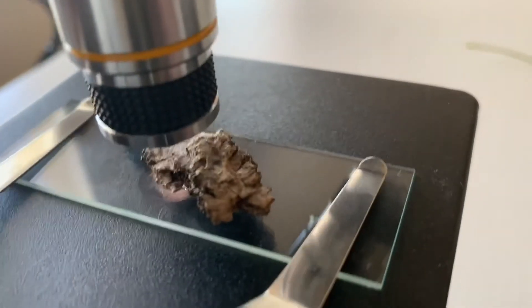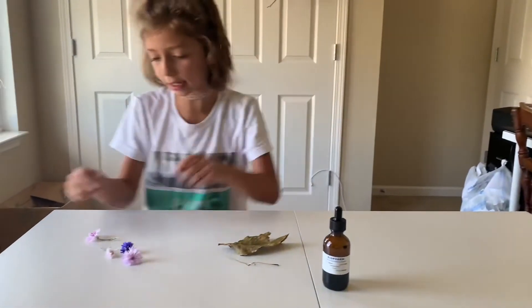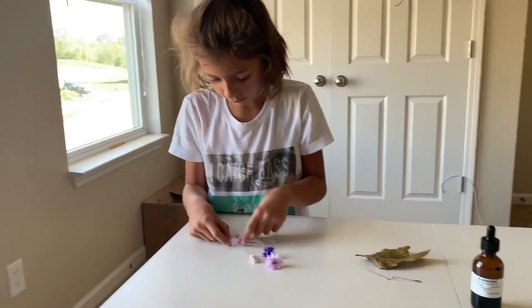Is that the inside? The flowers, Daddy — I want to see it first! We're looking at a flower. Why is it smooshed?